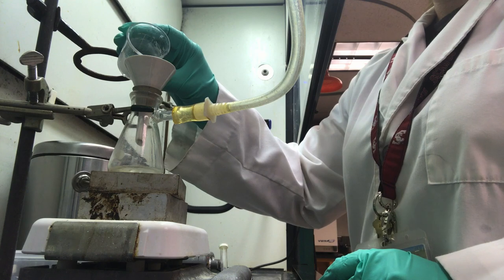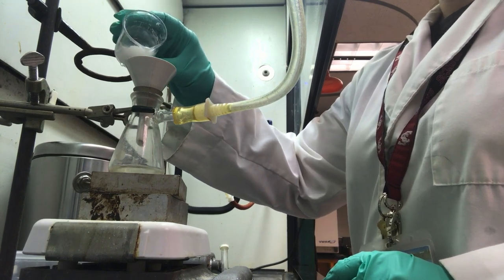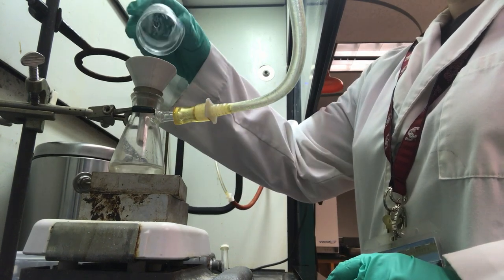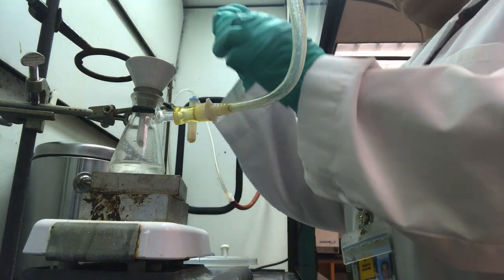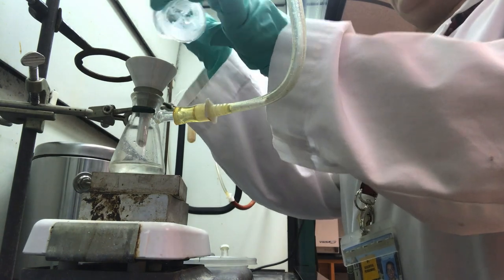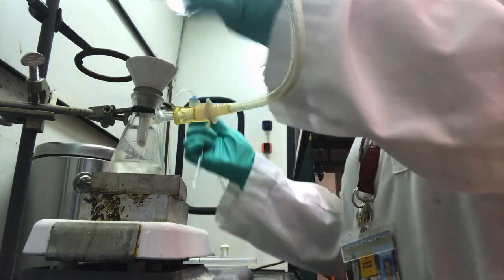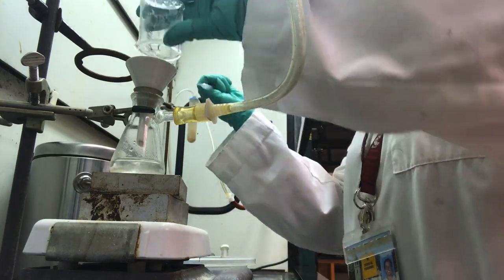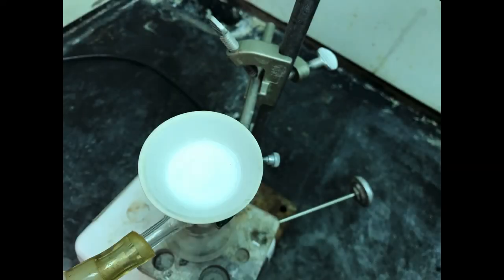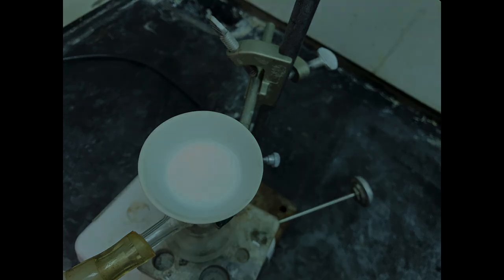Use ice water from your ice water bath to rinse the solids that remain in your beaker. Cold water is best so that we prevent the dissolution and loss of our carboxylic isolate. Allow the solid to dry on the vacuum filtration apparatus while you move on.